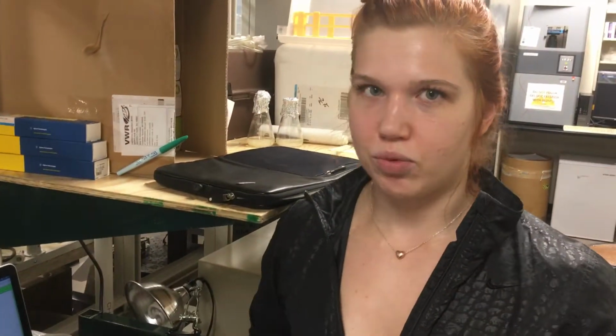And so here I have it set up so that the area percentage is equal to the gas composition percentage. And it makes it really simple, the volume gas composition percentage. That makes it very easy to calibrate and understand the results.